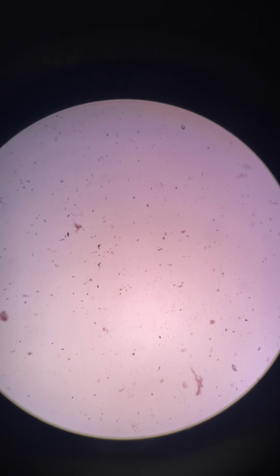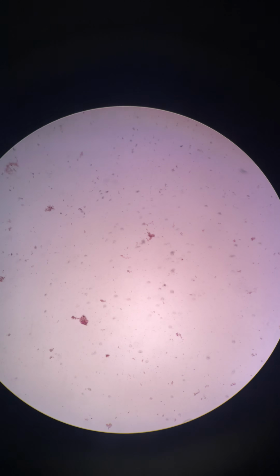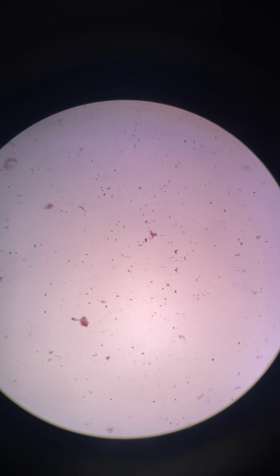All right, so today we're talking about diffusion and osmosis, and we're starting off with Brownian motion. And so here we are looking at a slide with carmine dye. This is a red dye made from the ground up shell of some kind of a beetle, and the particles range in size hugely from the micron scale all the way down to the nanometer scale where it's impossible to see them.